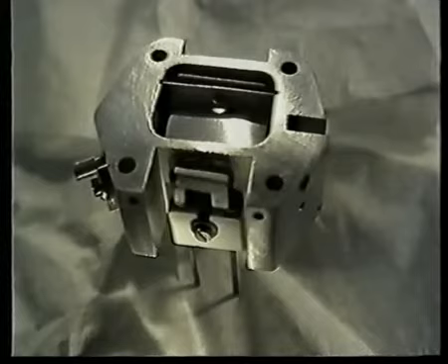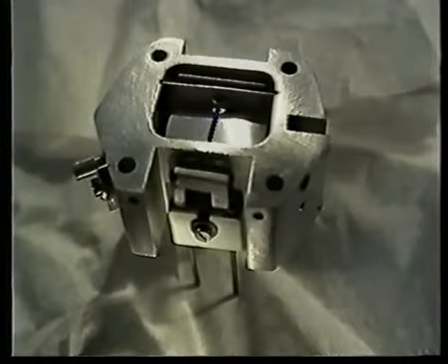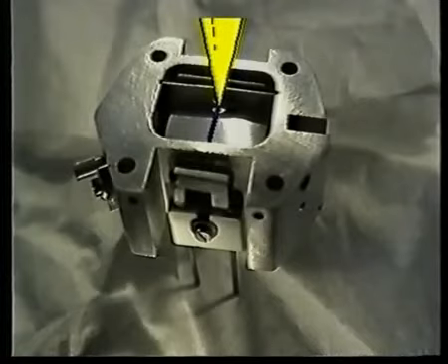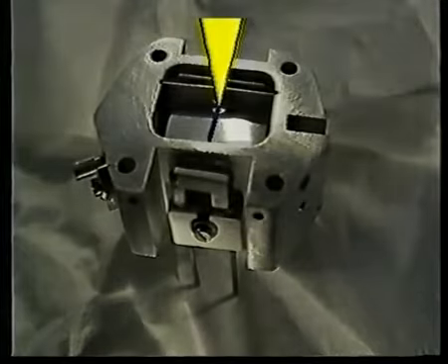Electrons emitted by a hot filament located here travel across the ion block by passing through the exit slot to the top positive plate. As they cross, the electrons, shown in blue, strike molecules of the sample, so ionizing them. Positive ions, shown here in yellow, are created. They are repelled at right angles to the direction of the electron flow and attracted towards a negative electrode, or cathode, further along the apparatus.